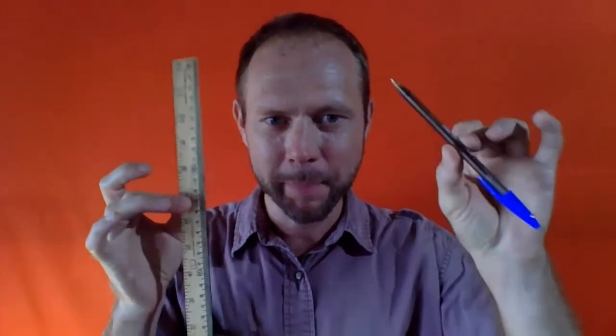Okay, so before we actually do the experiment, we're going to get our data table ready. You want to get a pen, not a pencil, but a pen to do your data table, a ruler, or at least a straight edge to draw it out, and some blank paper, maybe some graph paper. Lined paper is not going to look so good. Again, a pen, not a pencil, and a ruler.